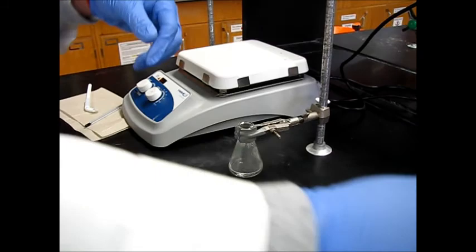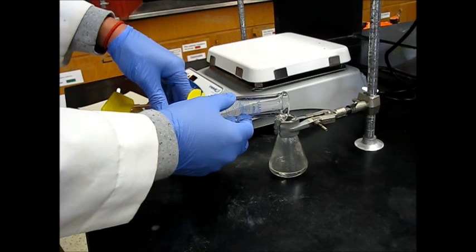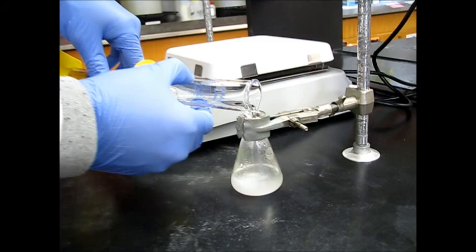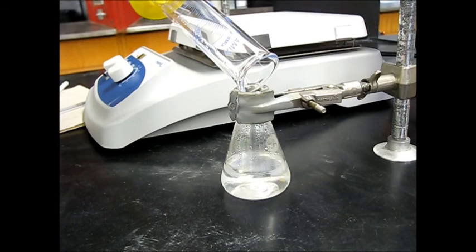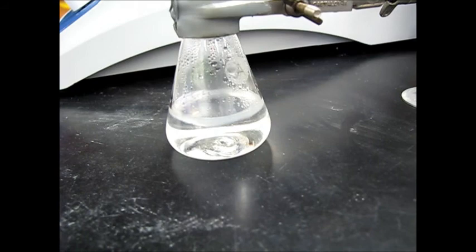I'll turn this back down just to be safe. Now what we're going to do is add 20 milliliters of water to fully stop the reaction. So you already see some precipitate forming. That's going to be our aspirin.